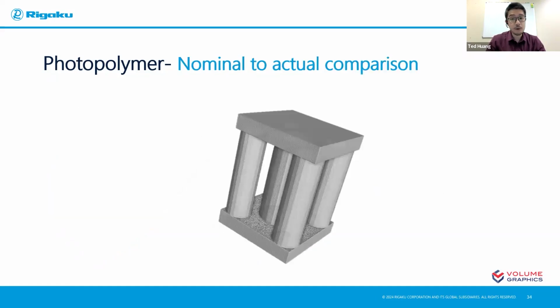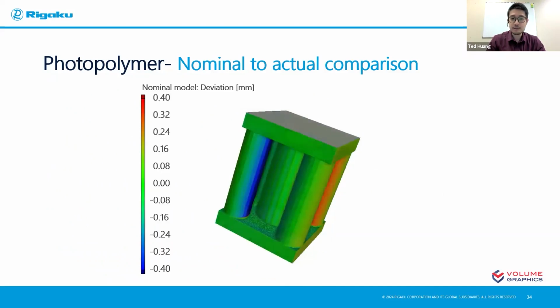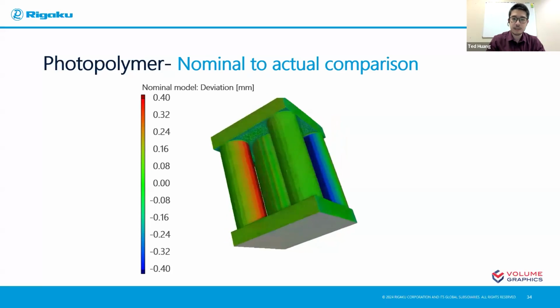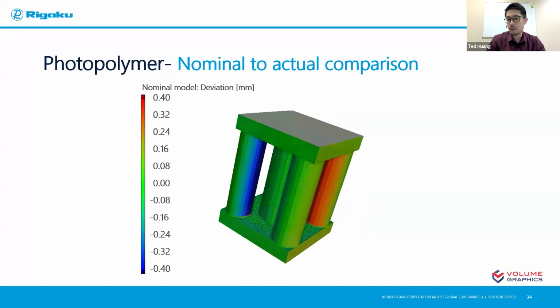So to do that, we overlap our CAD drawing model with our scan that we obtain. And would you look at that? We actually do have some nominal to actual deviation that we didn't notice. There's one pillar that's having positive deviation, meaning it's actually larger than design, and one pillar that's smaller than design. And that will cause some uneven load condition, right?